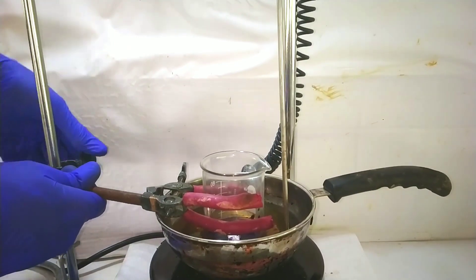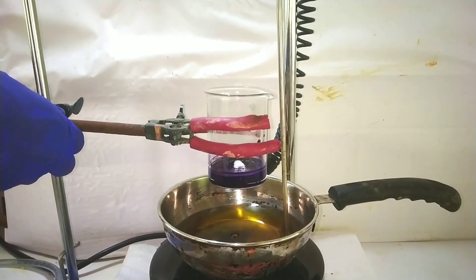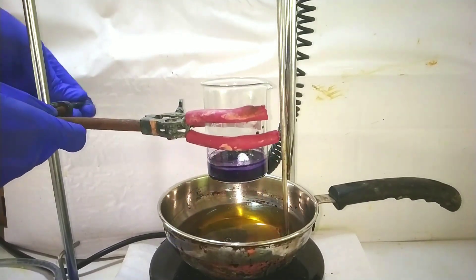After about two hours, the reaction is complete and I switched off the hot plate and took out the beaker for cooling to room temperature.